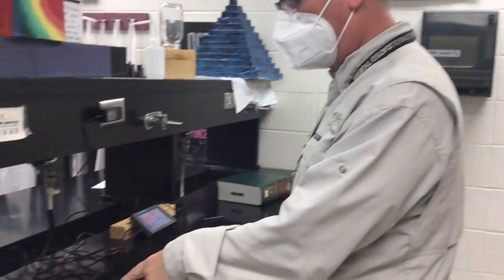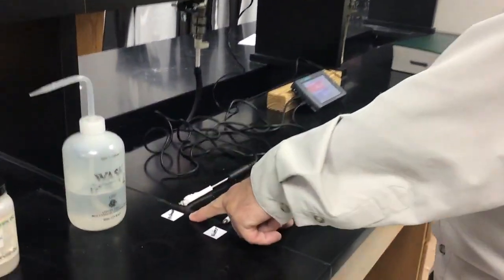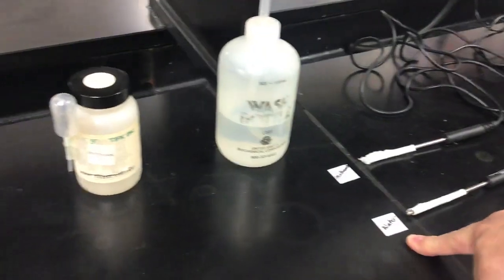Okay, so we're doing the last two of the evaporative cooling process. I have two temperature probes. The last two samples were methanol, which we have here, and distilled water. And we're going to use the same thing. So if you come around to this side, you can kind of video me putting these on here, I suppose.